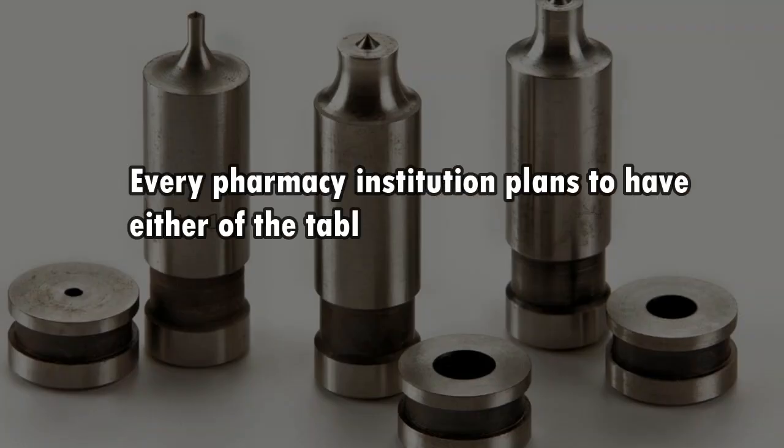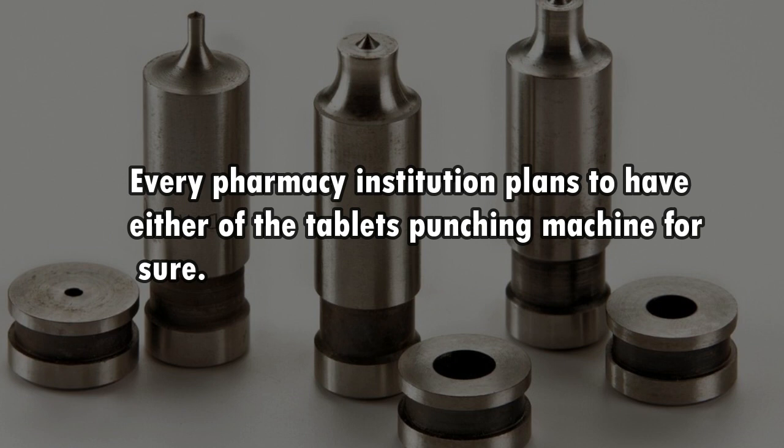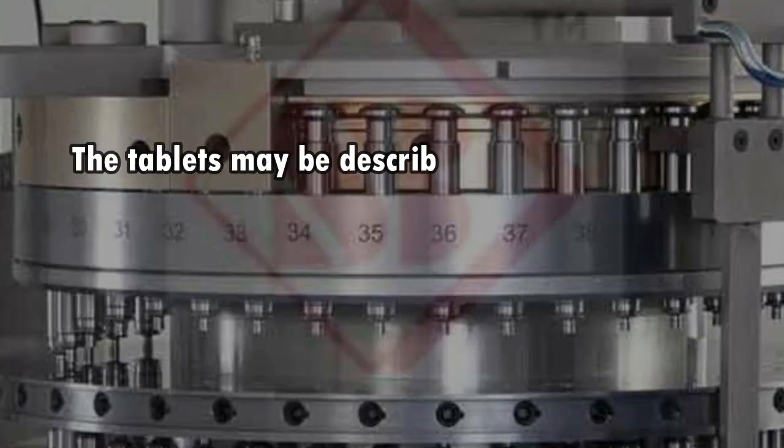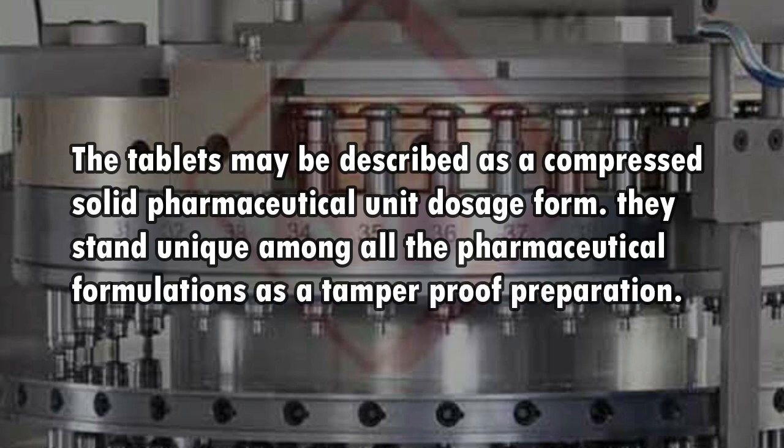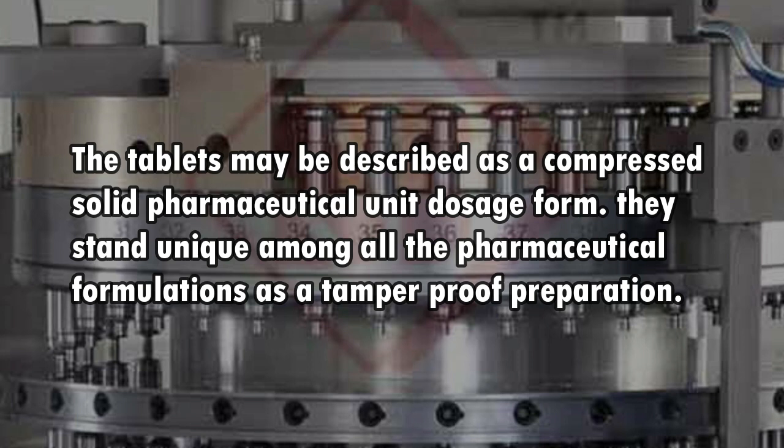Every pharmacy institution plans to have either of the tablet punching machines. The tablets may be described as a compressed solid pharmaceutical unit dosage form. They stand unique among all the pharmaceutical formulations as a tamper-proof preparation.